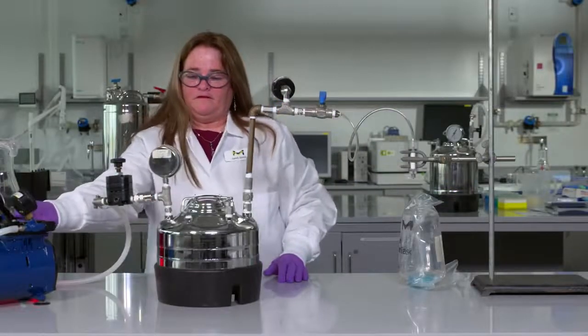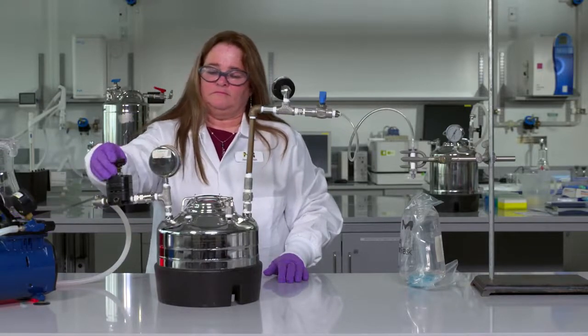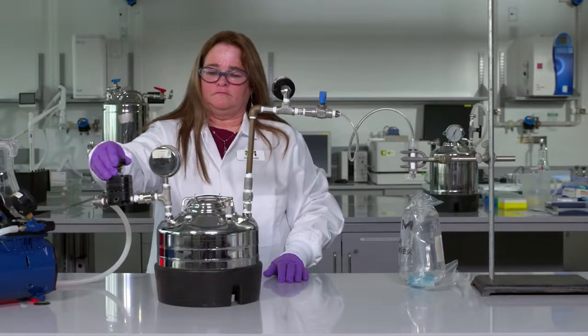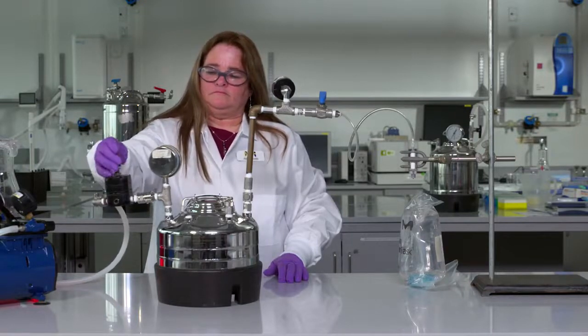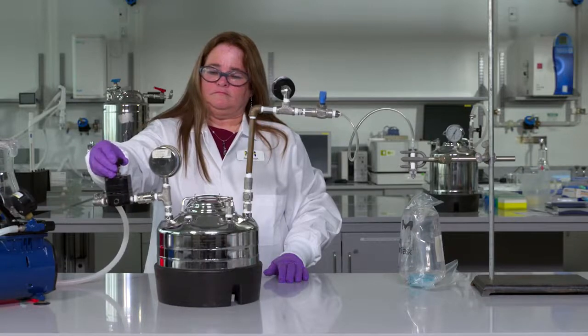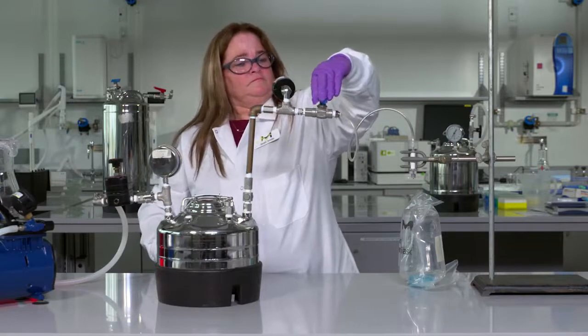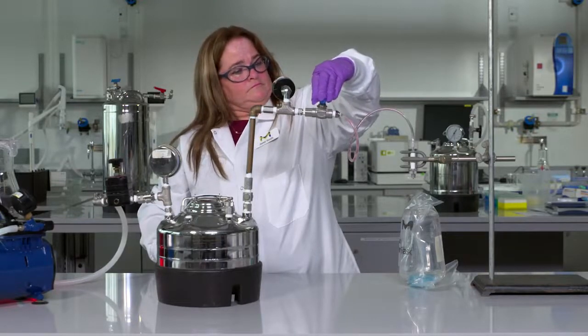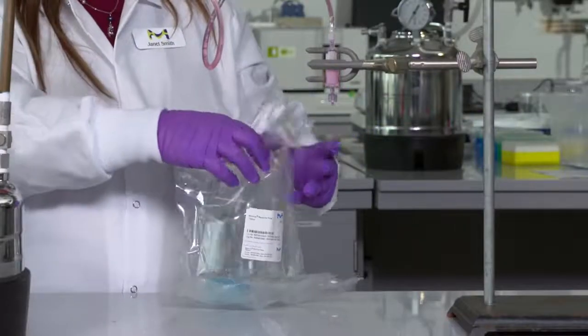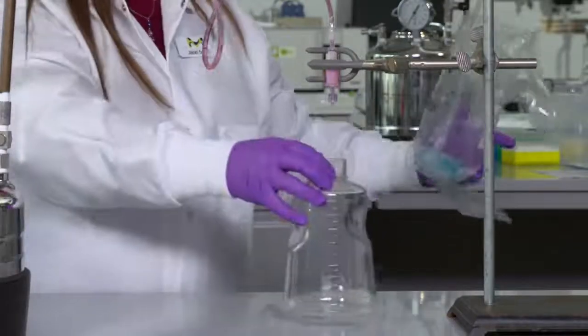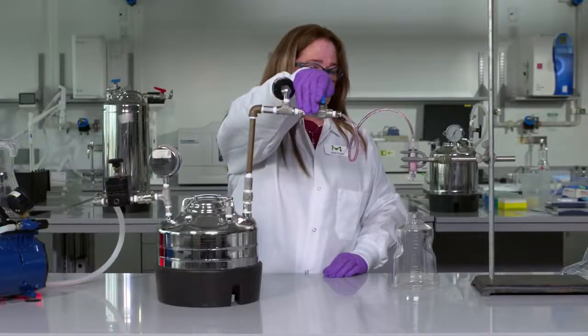Turn on source pressure. Today, we will be setting up this filtration at 1 bar. Slowly open inlet ball valve to dispensing vessel and allow vessel to pressurize. Open outlet valves slightly to introduce fluid into the outlet. The air from the line should vent through the device until liquid reaches the device. Hold the device over a sterile collection container. Open valve all the way and begin filtering into container or containers.